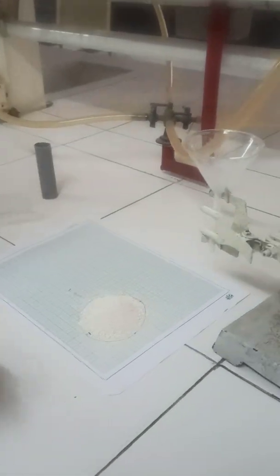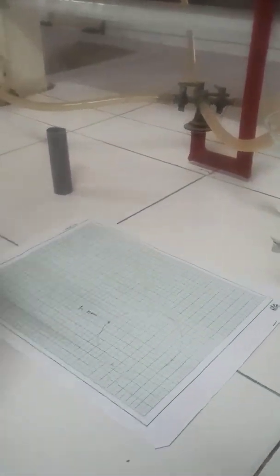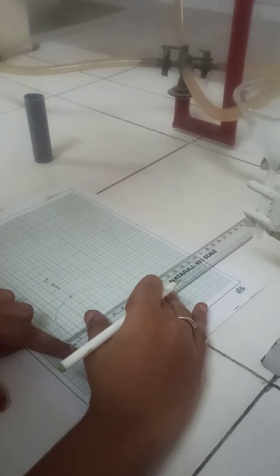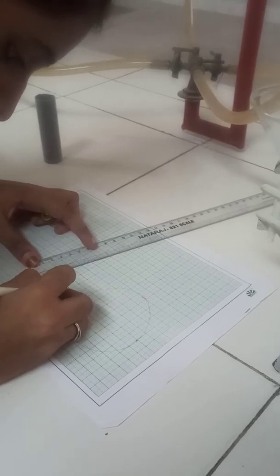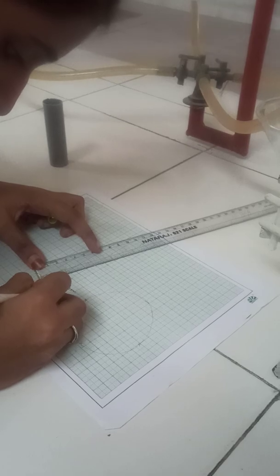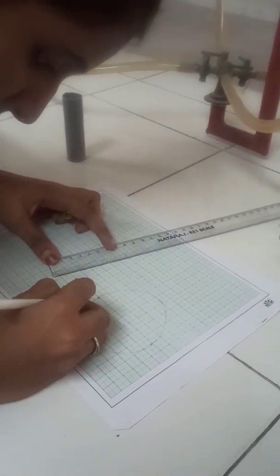Now remove the sample into the beaker and measure the diameter of the circle, which is taken as diameter D. Half of the diameter equals the radius.